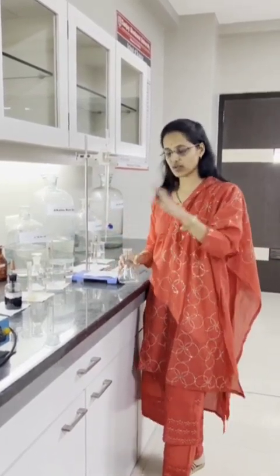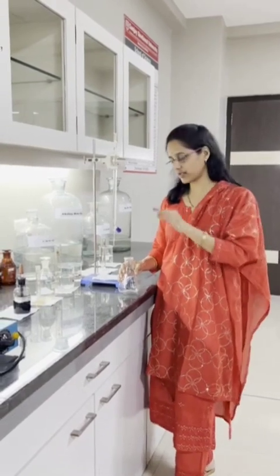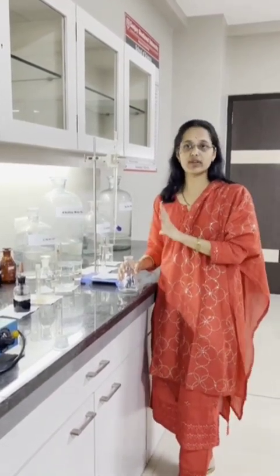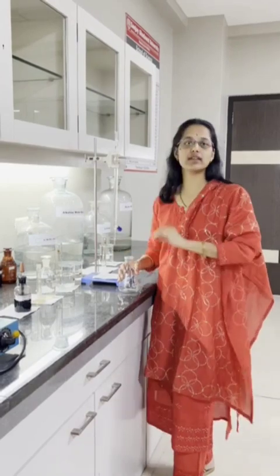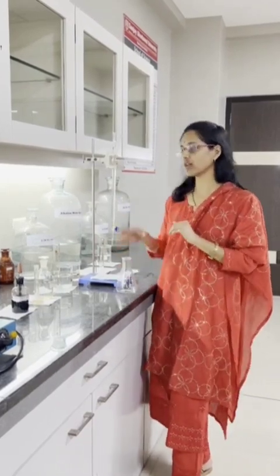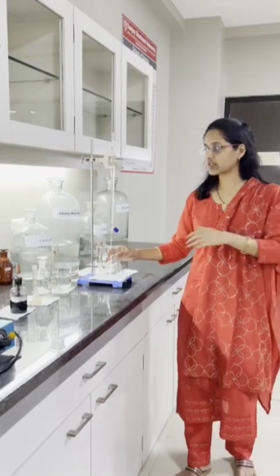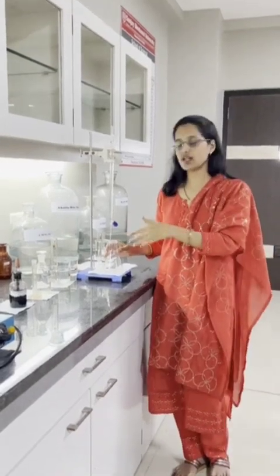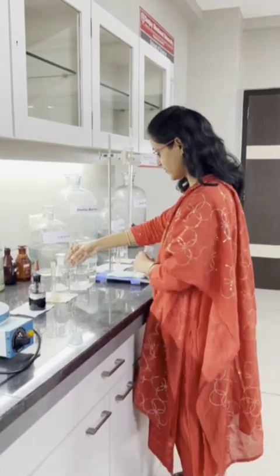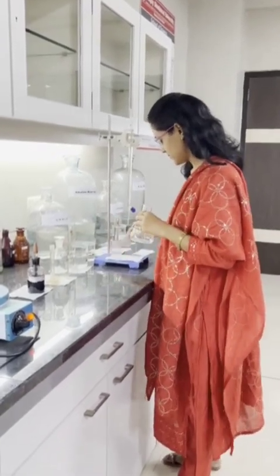What is the procedure to calculate the total hardness? First of all, we have to prepare 25 ml of water sample, then we have to add the EBT indicator, then the buffer solution, and whatever color we are getting, it will be titrated with the EDTA solution. First of all, I will take the 25 ml water sample.